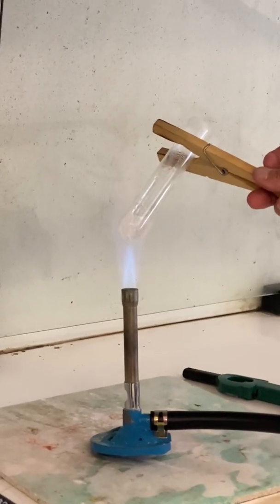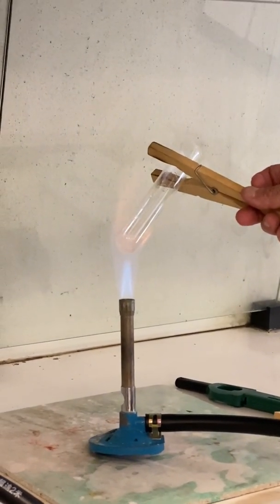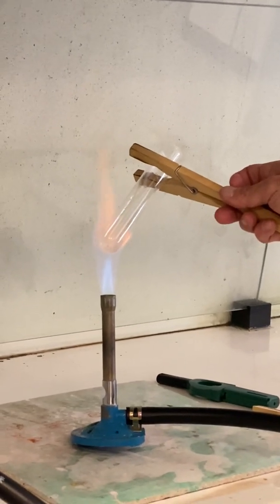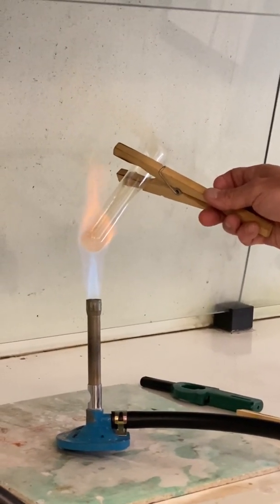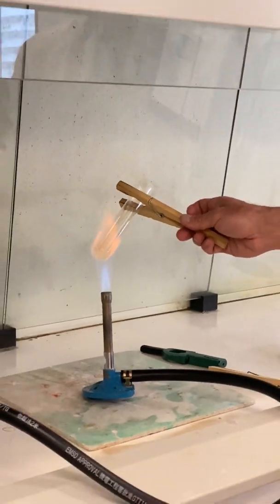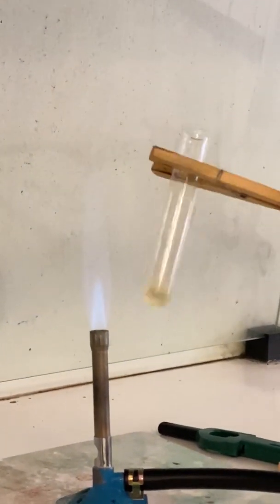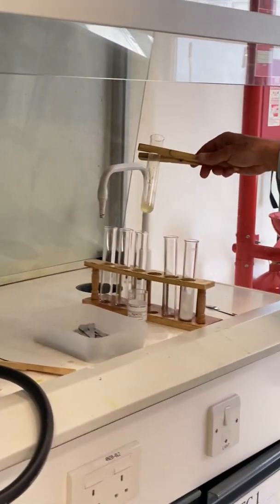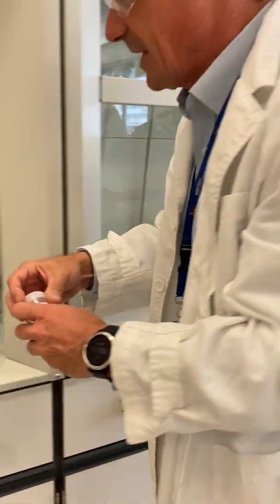We've got to that point now where we're just waiting to see if we're going to get any brown smoke. Come on lithium, don't let me down. And lo and behold — there we are, brown smoke. There's definite evidence of brown smoke coming off with the lithium nitrate. So the lithium nitrate has decomposed to form some nitrogen dioxide and some oxygen.